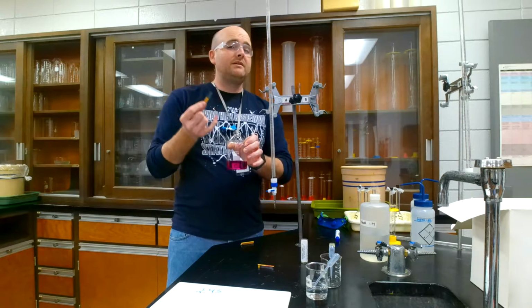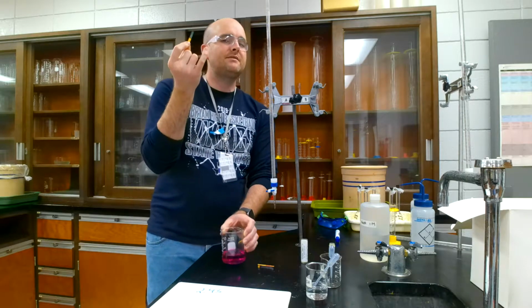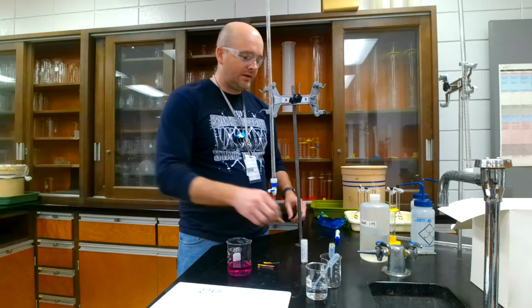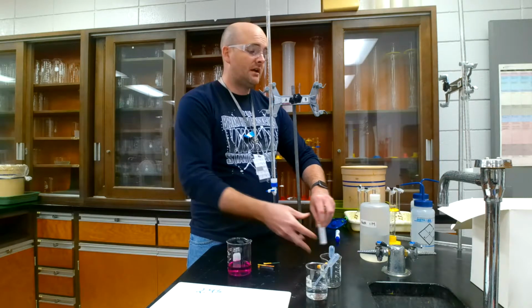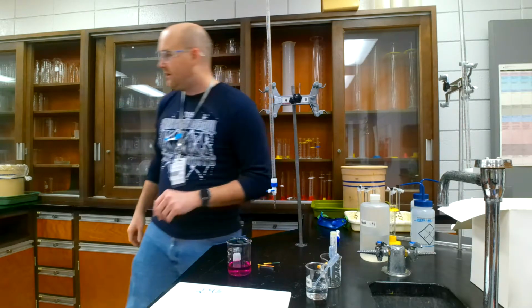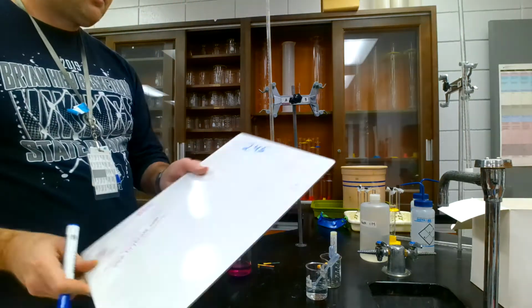So at that point, when it flips, when it changes from an acid to a base, that's a very important point. That's called the stoichiometric point, or the equivalence point. And that is where the moles of the acid equals the moles of the base. Very, very important. So that was probably, let's say, I added too much, so it's probably around 21.